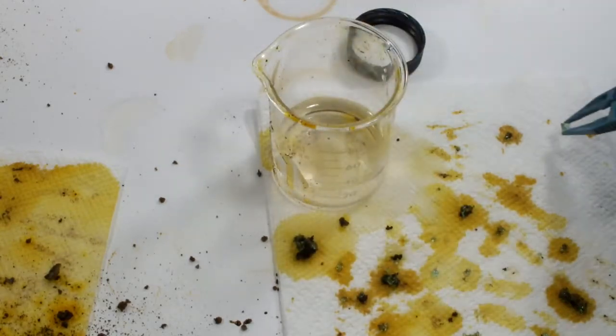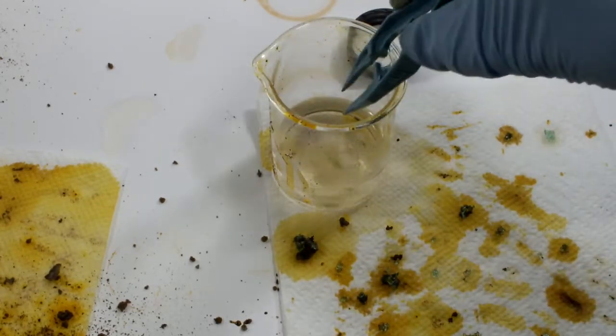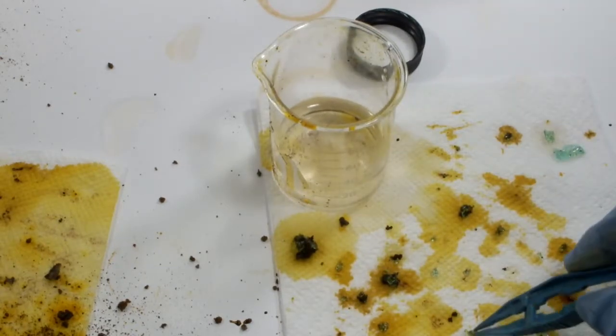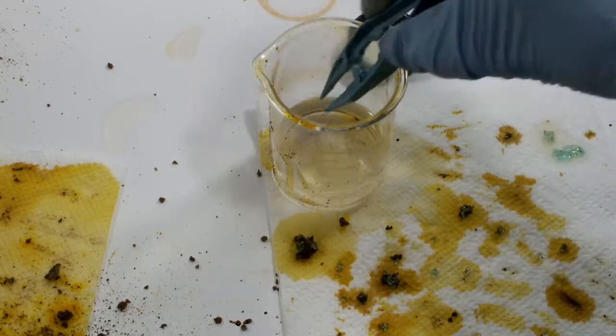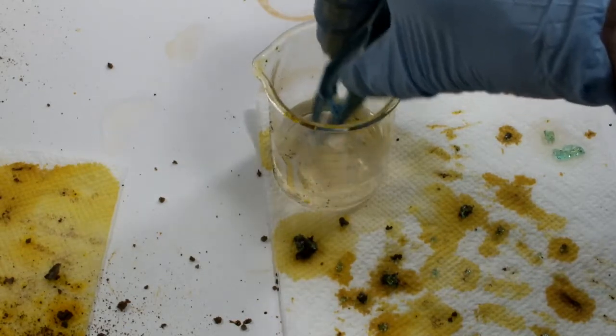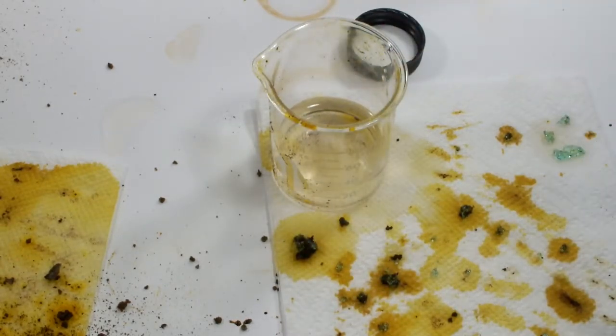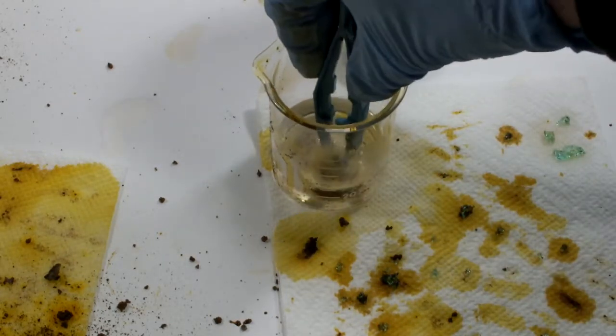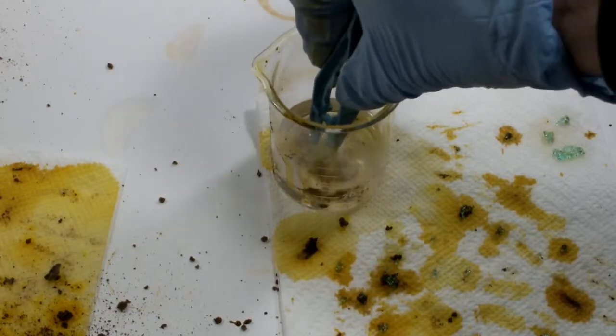It took a week or so for one of the crystals to get really oxidized sitting on an open bench. Being in a bottle will prolong their useful life, but not indefinitely. This stuff has a finite shelf life and has to be used within probably a year or so from when it's new, which means with how quickly I use chemicals, I should probably never order it.